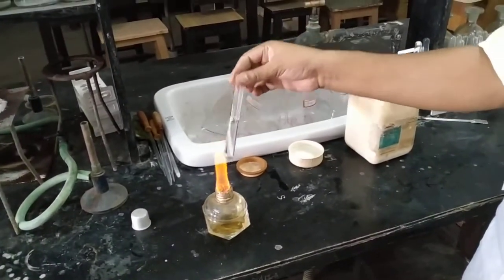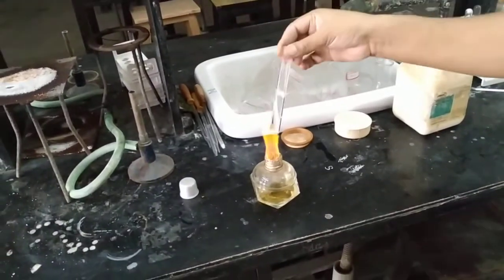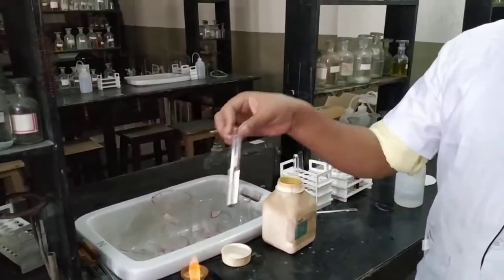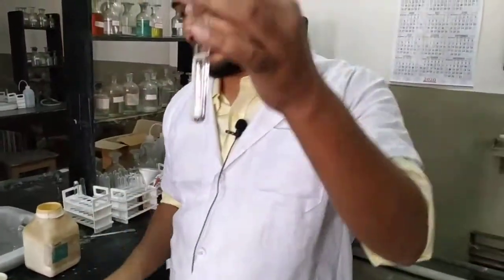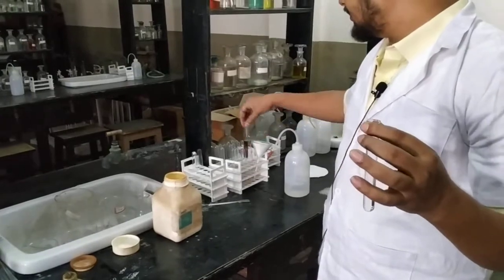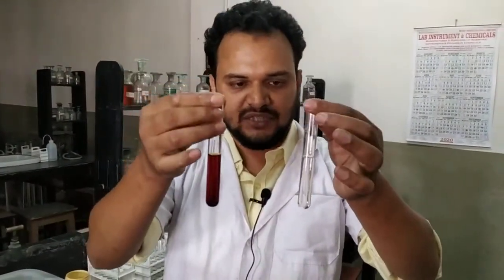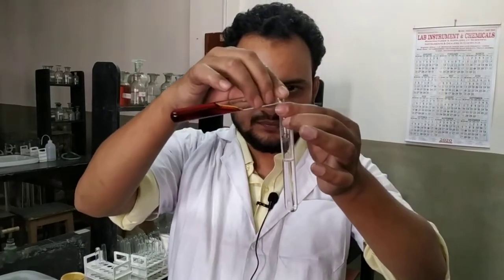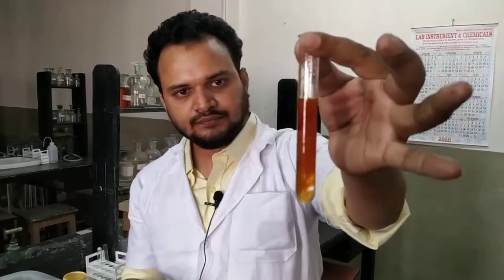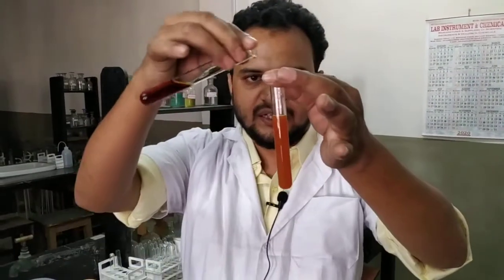It is not completely dissolved yet but very soon it will dissolve. Now it is almost dissolved — this is a clear solution. Now I will add this neutral FeCl3 and you will get a buff precipitate. See, a buff precipitate is formed. You can add a little more.